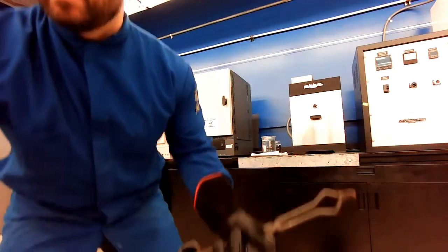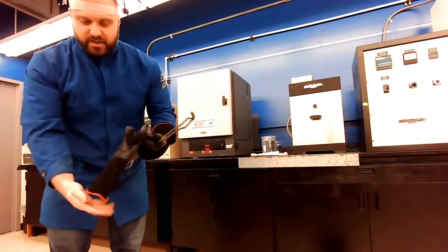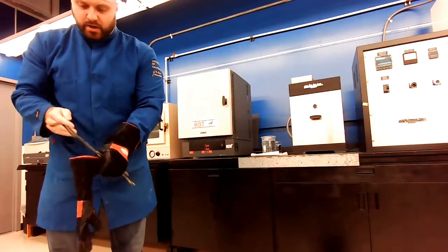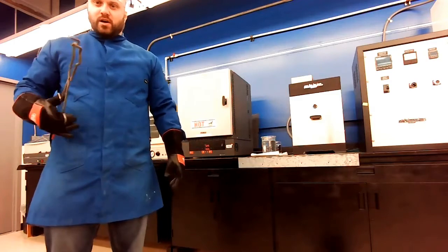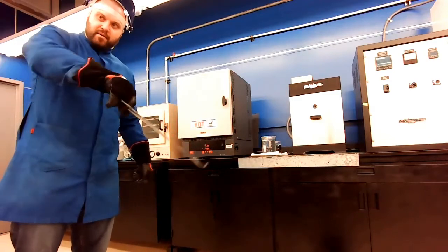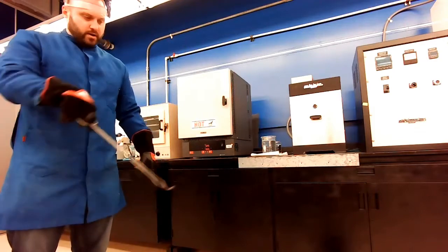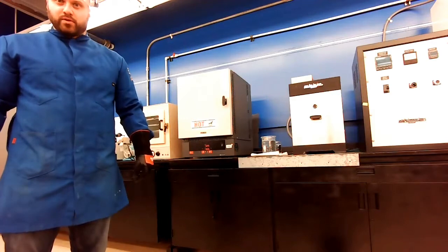You can see I have my safety jacket on. I have a face shield, and I'm putting on my high temperature gloves. So what I'm going to do is I'm going to use these tongs to get in there and get our first sample out. And then I have a bucket of salt water down here on the ground. I'm going to mix this in and quench this sample down, all right?